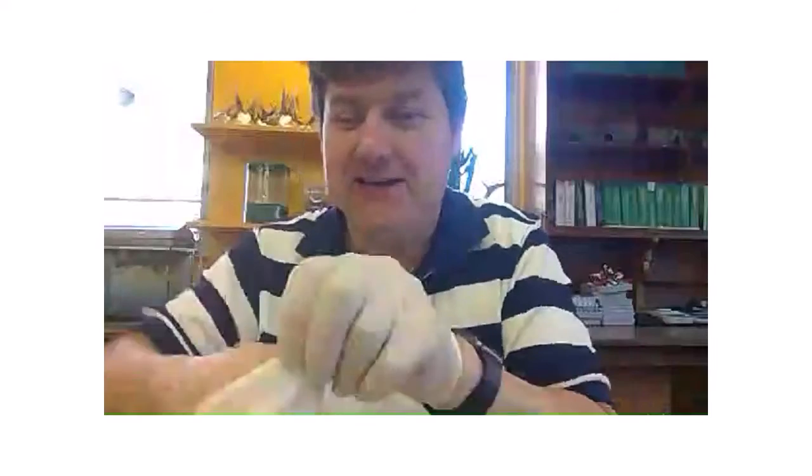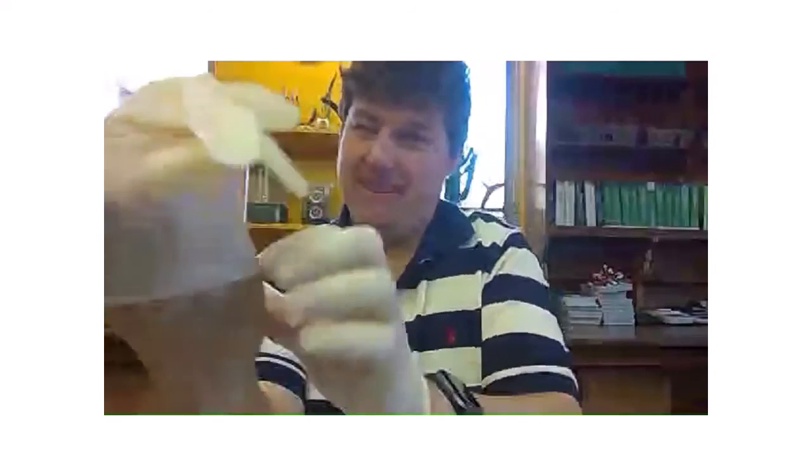What animal is it? Pig. It's a pig's kidney. So it's off a pig. No cavity searches.